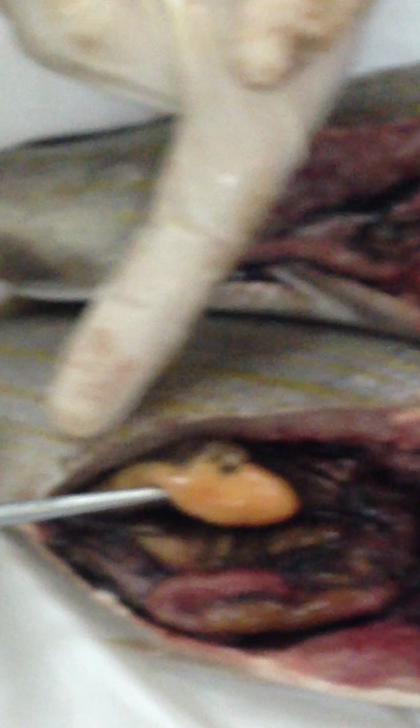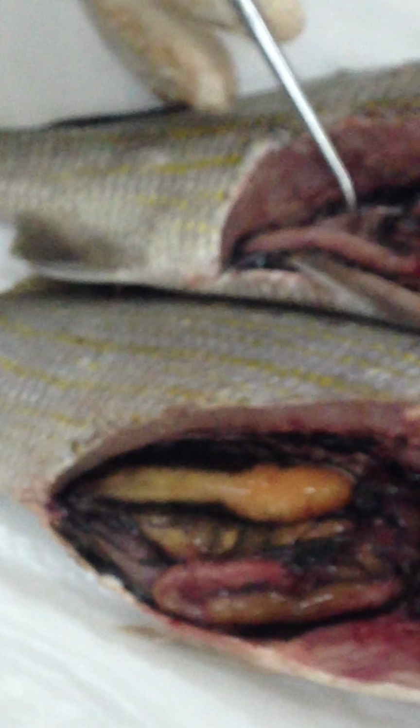Then this is the gonad. On this side, this is the gonad for this fish. Now can you see the difference between this gonad and this gonad? That's a boy and that's a girl, or you can say this is the male and this is the female. Because if you try to cut this, you're going to feel a lot of granules in that gonad, which would be eggs. If you do the same thing with this, nothing. You wouldn't see anything. So that would be the testis. But in your exam, you don't have to identify whether testis or ovaries. Just identify them as gonads. That would be enough.